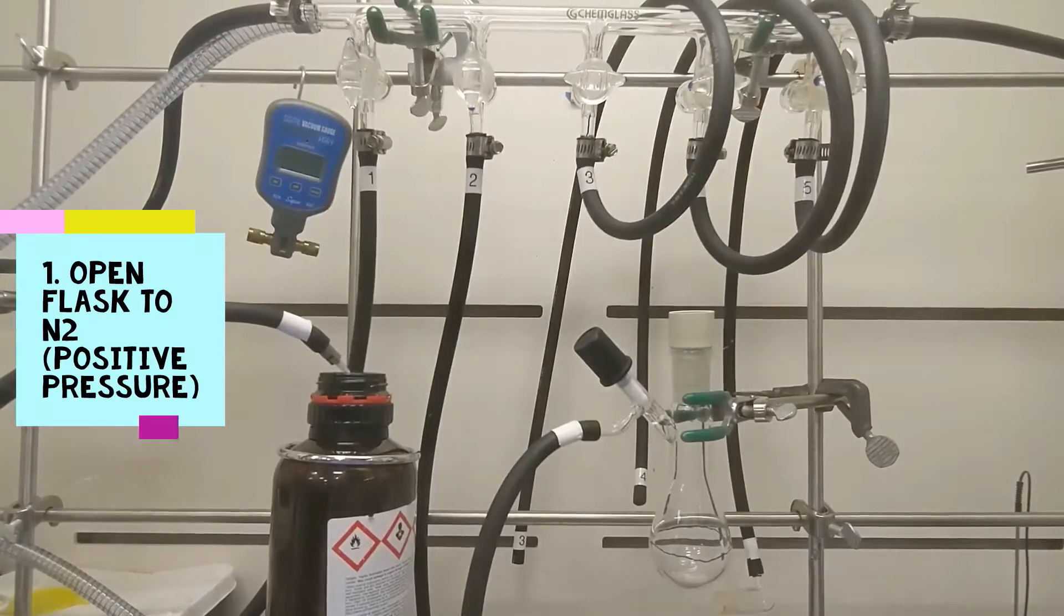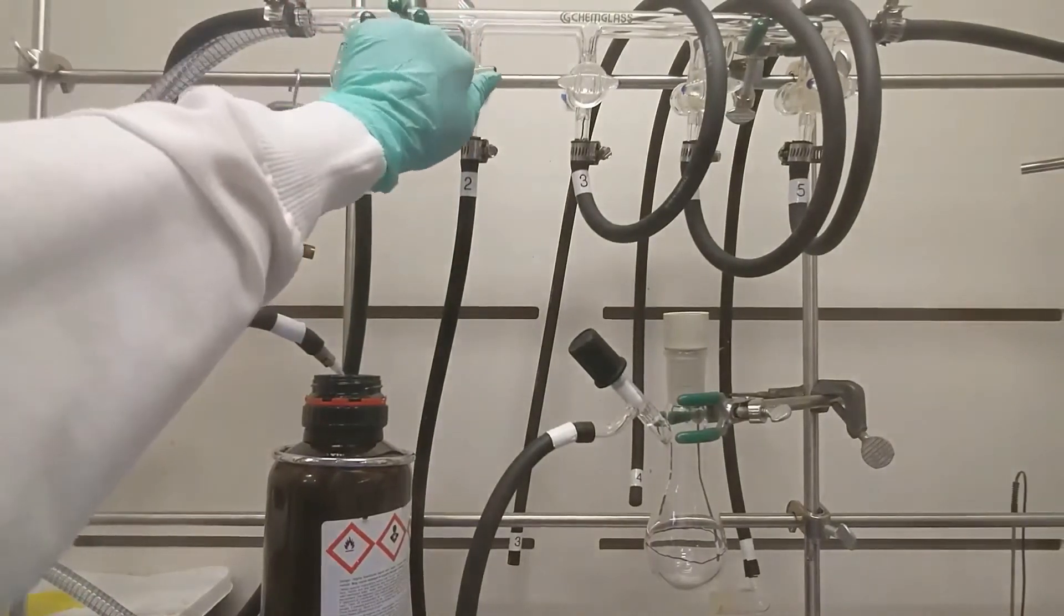First step, open your flask to nitrogen. Now both your solvents and flask should be under positive pressure.